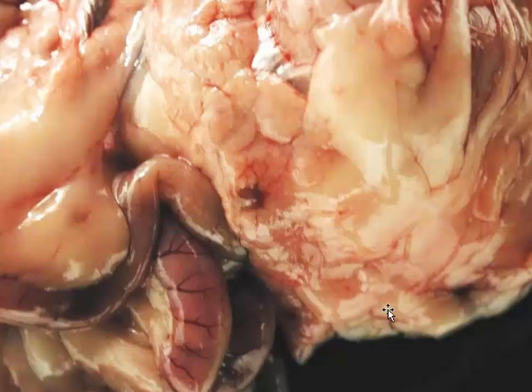Slide number 3 is tissue from a ferret. Can you give me a morphologic diagnosis? Okay, time's up. You have to sort of look at this one pretty carefully. We're looking at the pancreas right here. There is a reddish nodule in the pancreas. And this is what a pancreatic insulinoma looks like in a ferret, also in a cat, or in a dog.